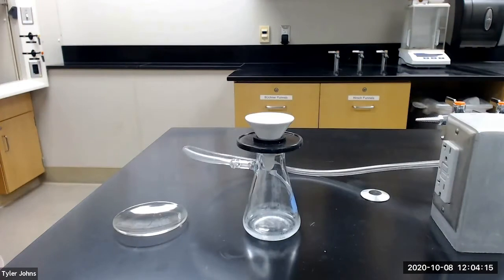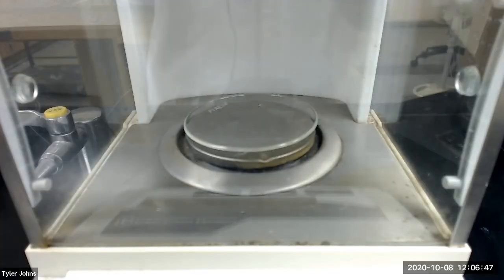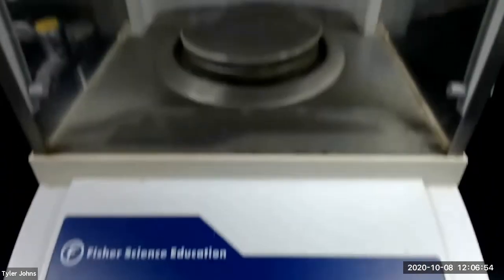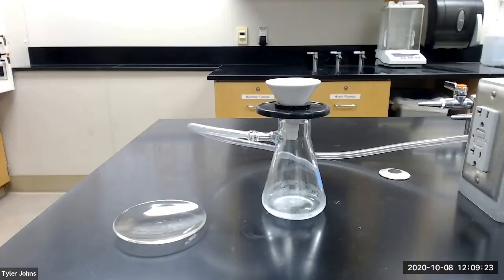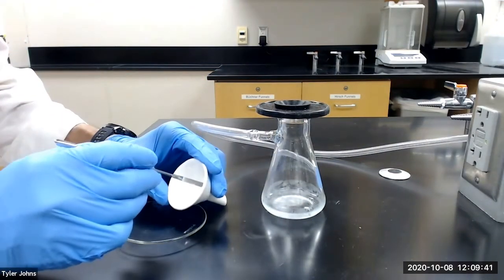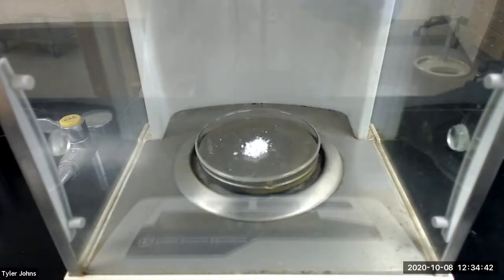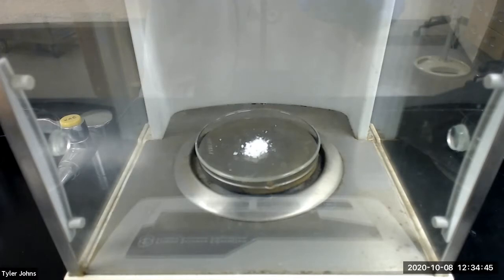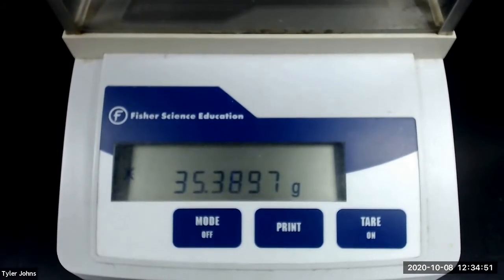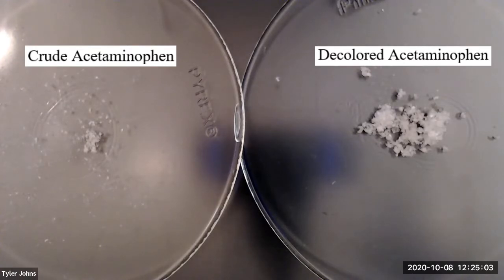While our acetaminophen continues to dry, we need to pre-weigh a watch glass. The mass of our pre-weighed watch glass is 35.2569 grams. We now need to collect our decolored acetaminophen crystals on our pre-weighed watch glass. The mass of our pre-weighed watch glass and decolored acetaminophen crystals is 35.3897 grams. This is the color of the purified acetaminophen crystals compared to the crude product.